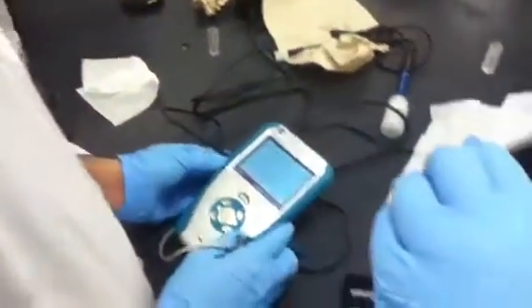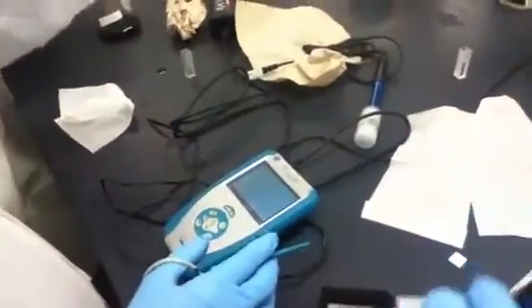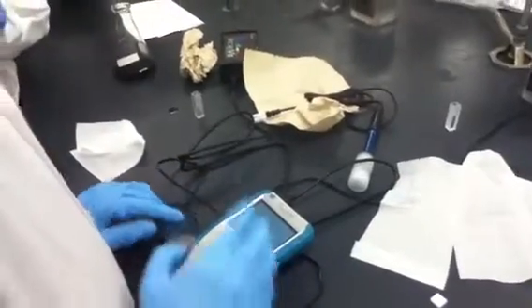This should connect to the USB somehow. So you tell it to calibrate, so you can see the screen. This one you can see the same thing in Professor, there. You told it to calibrate. I told it to calibrate it.